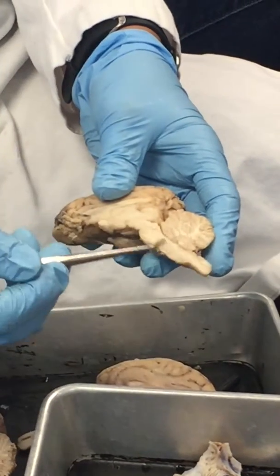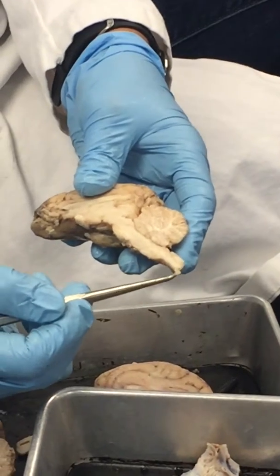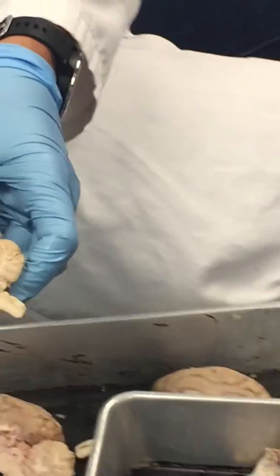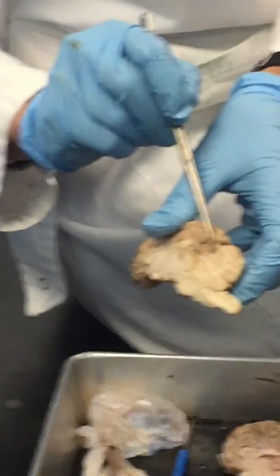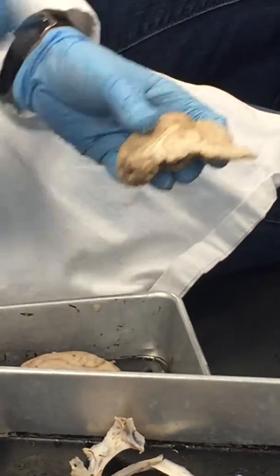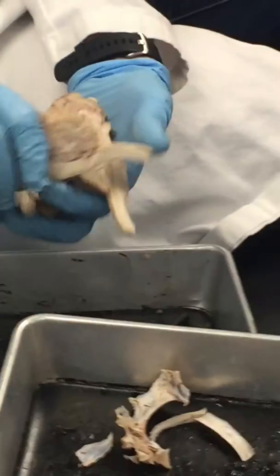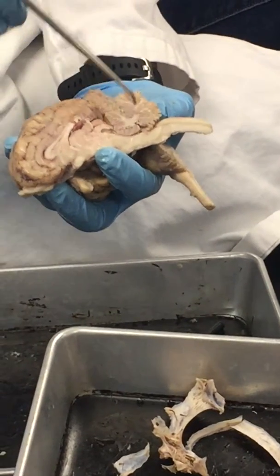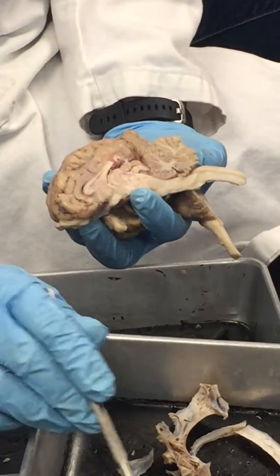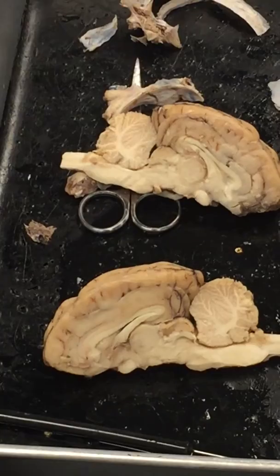Pons kind of bulges out a little bit. This brings us into our pons. Medulla is going to be all the way down here, spinal cord all the way down here. And then look at that. What do we see in there? The arbor vitae. The arbor vitae, right. So you have that tree of life, clear as day on there, isn't it? All that white matter on the inside, very pretty looking. All the white matter with the gray matter surrounding it. You can see it on there. Very pretty looking, right? Across the board. That arbor vitae leading down, okay?